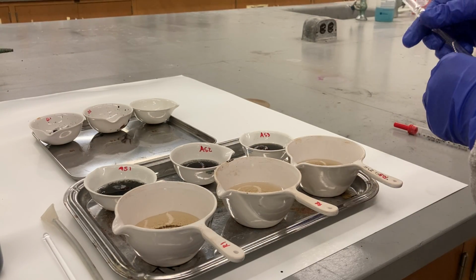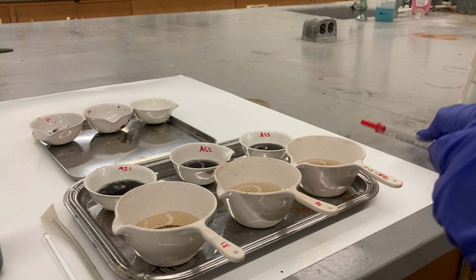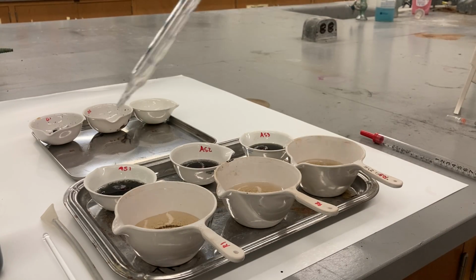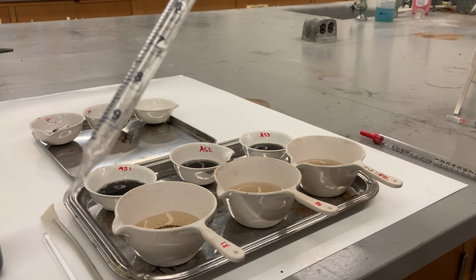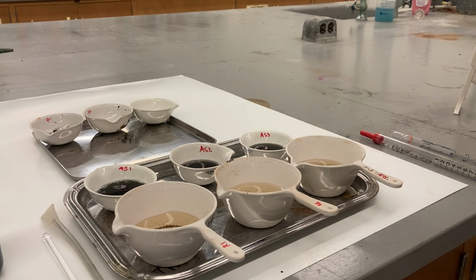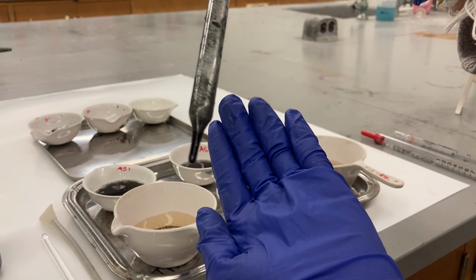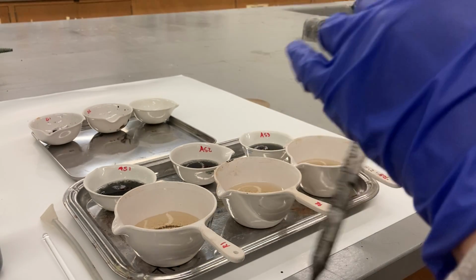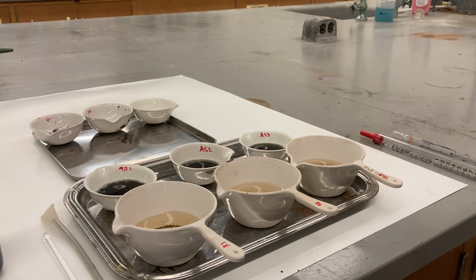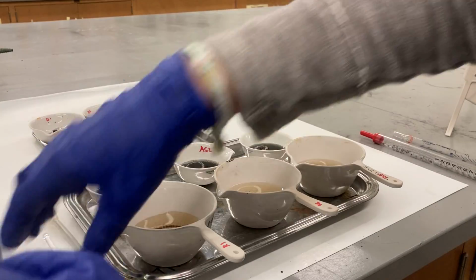Only that sample is very thick. You can see this pipette from the runoff is very clean. I still keep it because we need it in the future. This one comes from the activated sludge sample. Even though it's black because of the sulfur, it lacks oxygen. This one, I told you, comes from the digester sample. Most of it is dead bacteria cells, so that's why we need only 5. This one 50, 20, and this one only 5.